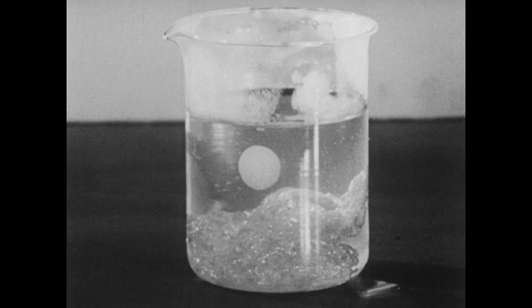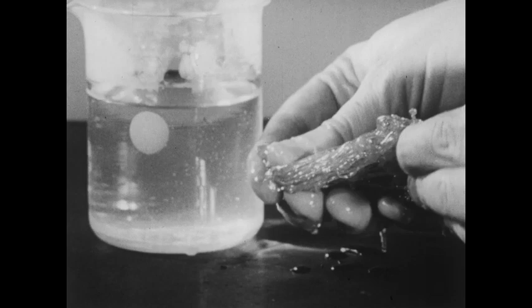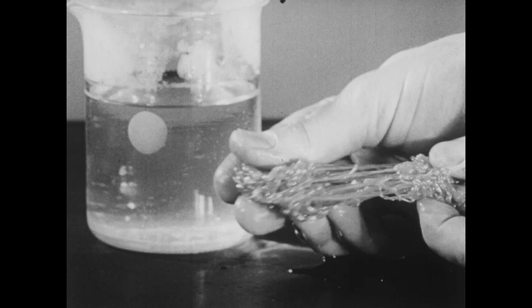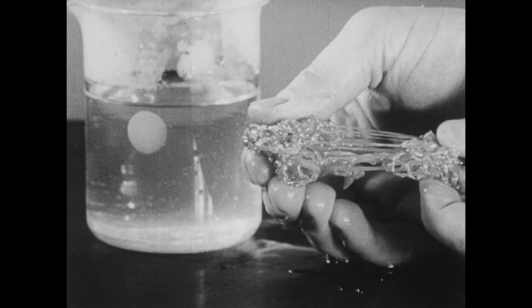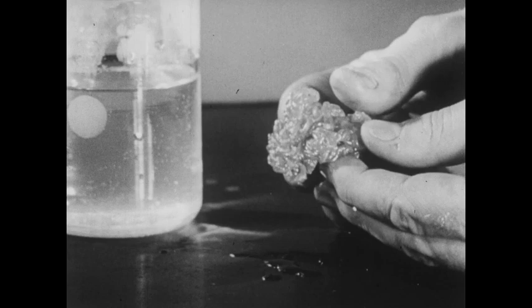The sulfur that we get by rapidly cooling sulfur near its boiling point has the appearance which you now see. This sulfur is no longer hard, but is instead flexible and rather rubbery. Sulfur in this form is called amorphous sulfur or rubbery sulfur. You can see that it has some stretch and the ability to retract when released after being stretched. This is really a supercooled liquid, and it will slowly revert to the crystal form which is stable at room temperature — the rhombic form.